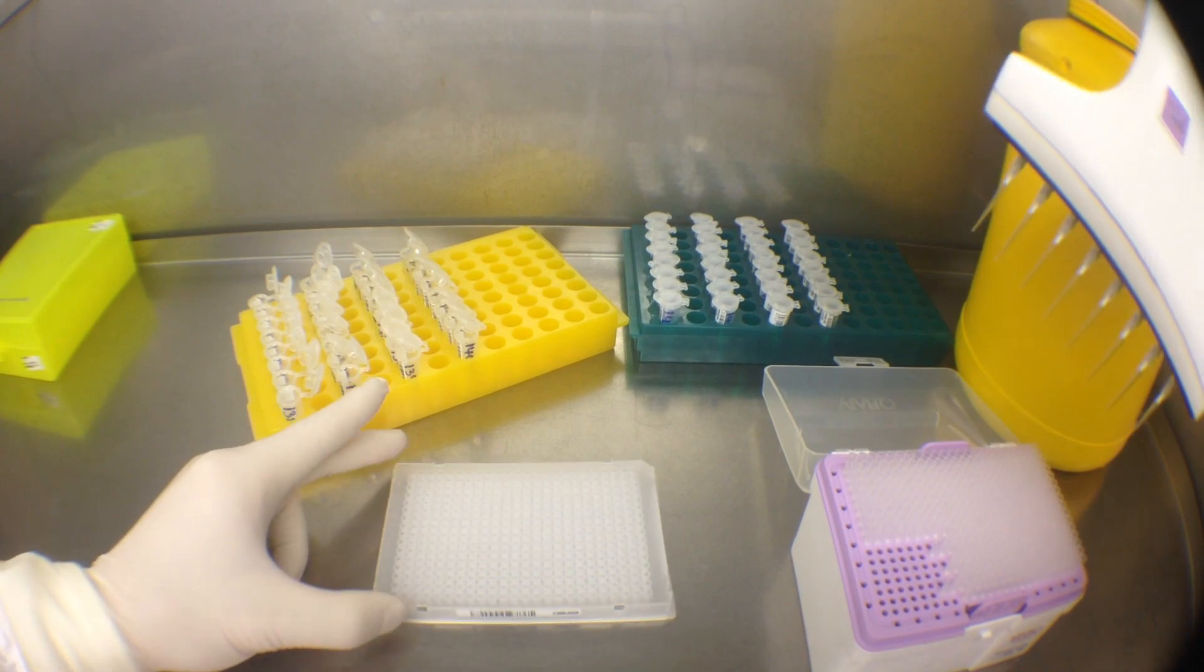This pipette has adjustable tip spacing that'll allow me to pipette straight from the Eppendorf tubes.